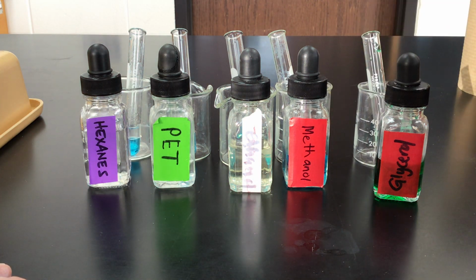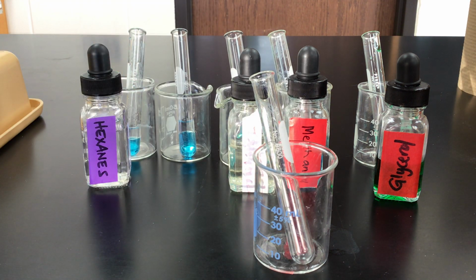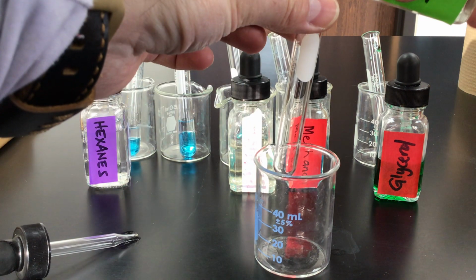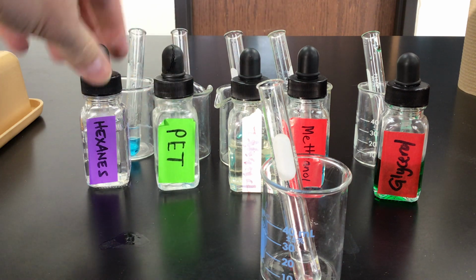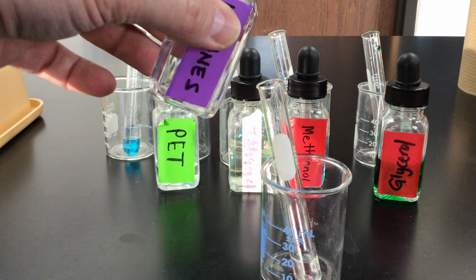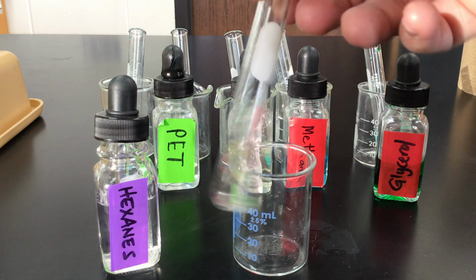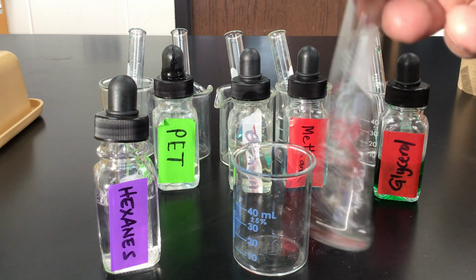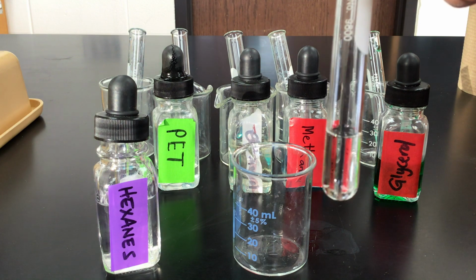All right. Next, what we're going to do is take those things that were not soluble in water, like the hexane and the petroleum ether. We're going to see if we mix those together, will they dissolve in each other. So that's what we'll do here. Take some petroleum ether. And then we'll mix in some hexane. Mix these around, see if they're going to be soluble in each other or if they'll be in layers. All right. And what we see here is I don't see any layers, so I would say they are soluble in each other.